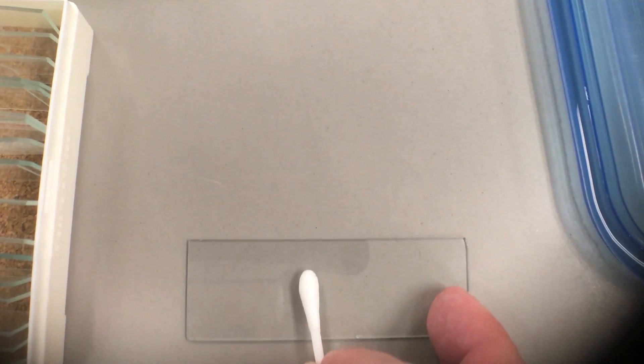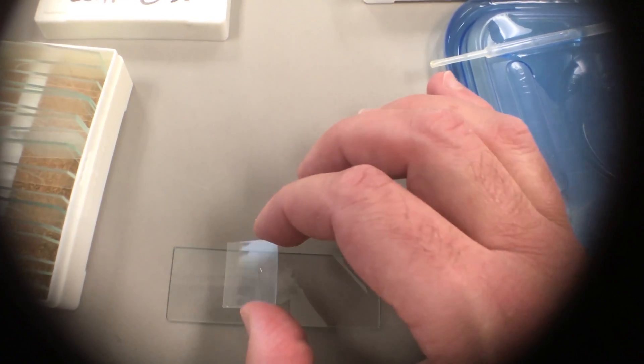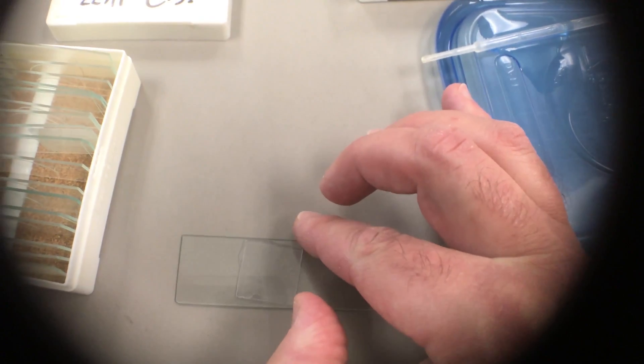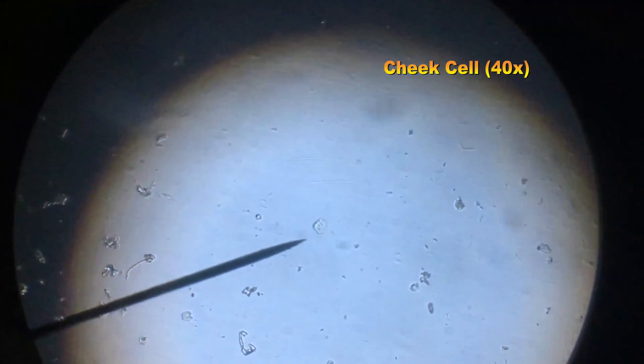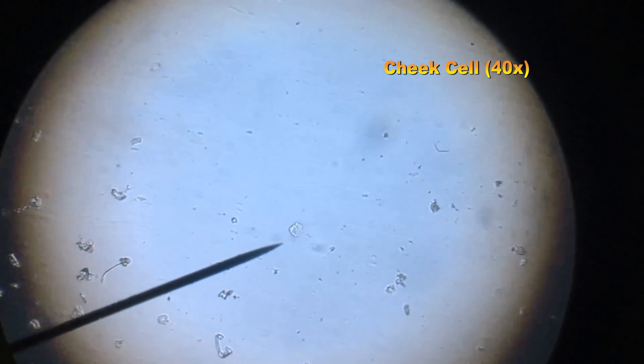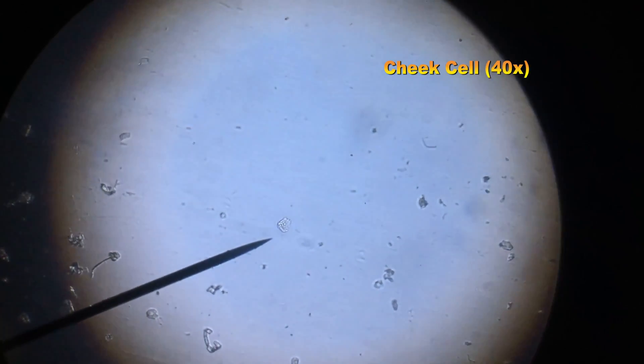Next, we'll be making a wet mount of our own cheek cells by smearing them onto a slide. The key here is to twist the q-tip back and forth, drop some water, and set on the cover slip. Here's a cheek cell — there are many pieces of debris on the slide, but at the end of the pointer is a cheek cell on scanning power.